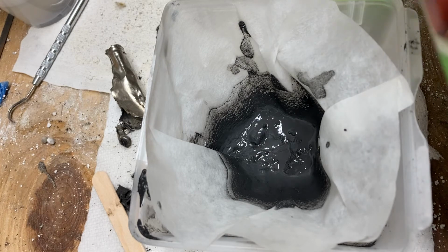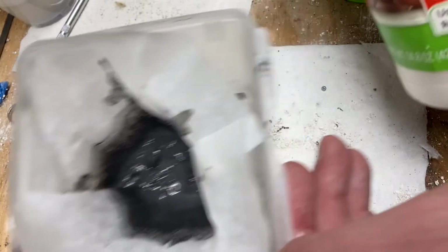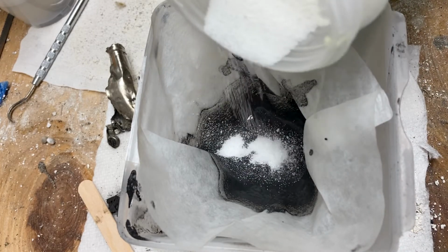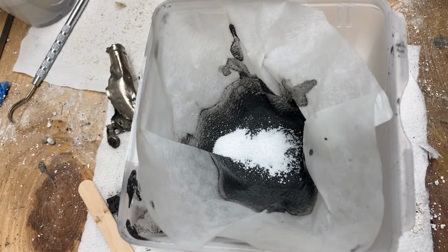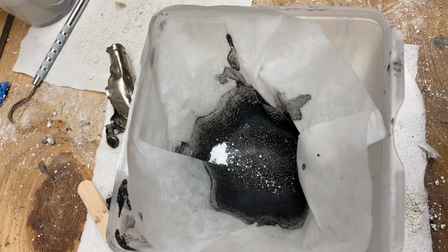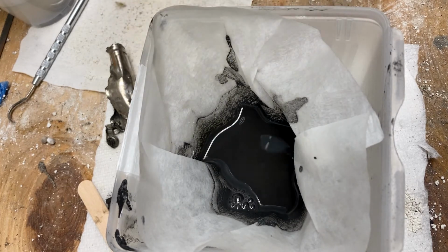And, nicely enough, citric acid is something that one can get very easily for canning supplies and such. So we will just put a little bit of that in there. The only real risk of putting too much in is that it's going to be soluble as well, and so it might be something I could mistake for the zinc oxide. That, by the way, is not exactly the kind of thing you want to breathe in all the time. But add a little bit of water in there.